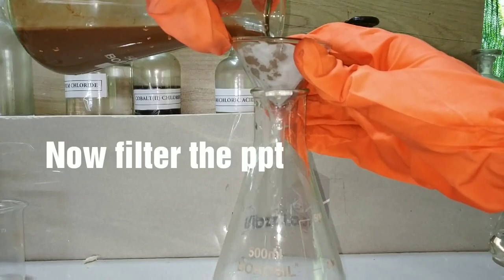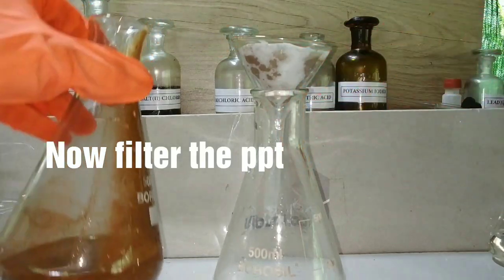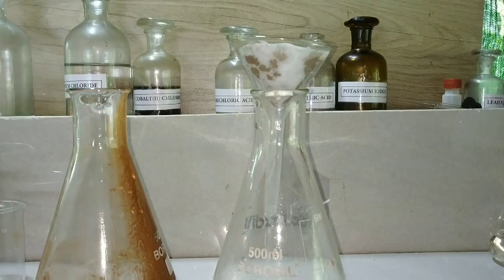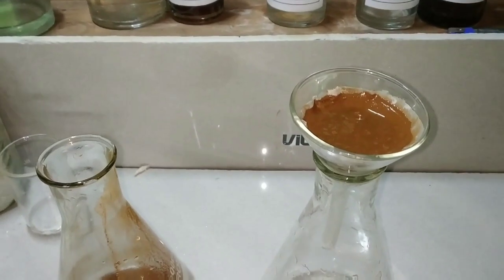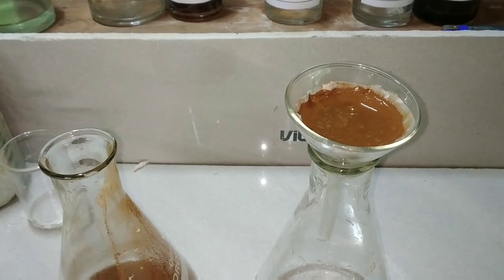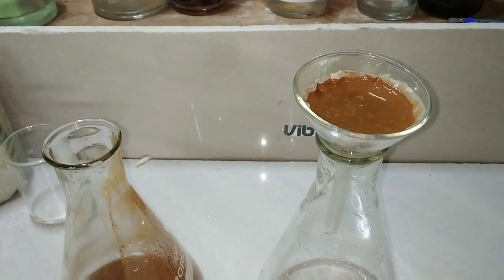After the vigorous rinsing procedure, now we will filter this precipitate. This is the crude precipitate of lead oxides.